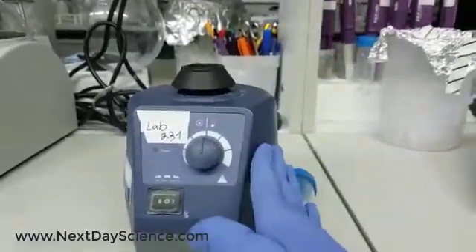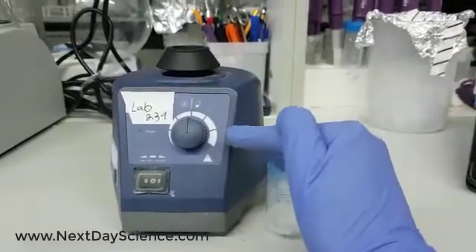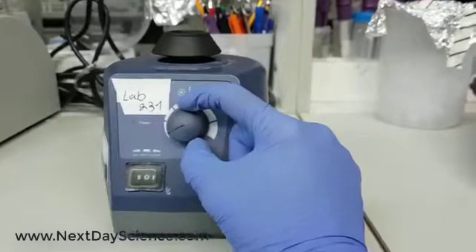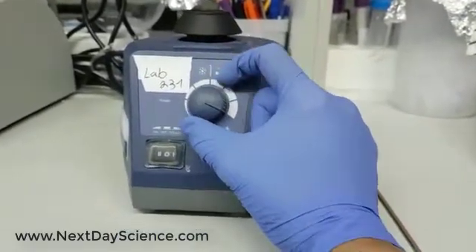Really easy — I like this button, it's really convenient. A tip: regardless of the speed indicator you see here, the indicator that lets you choose if you want to do a gentle mix or a massive one, you can control it yourself.